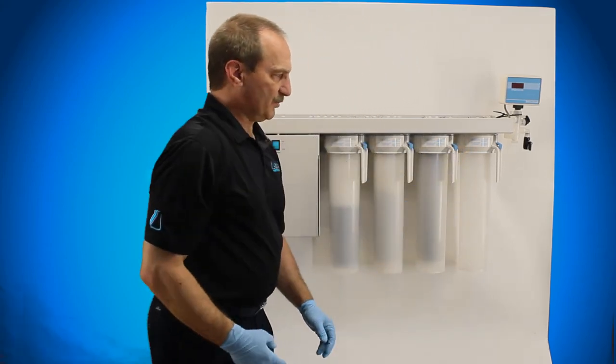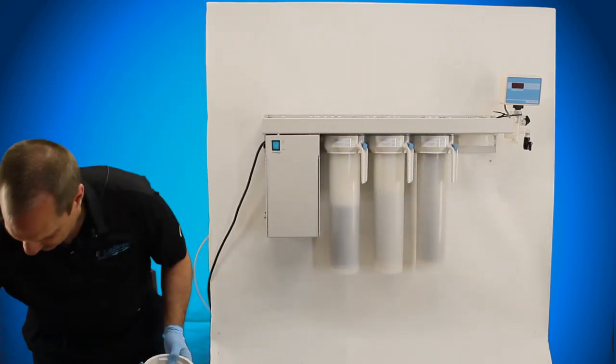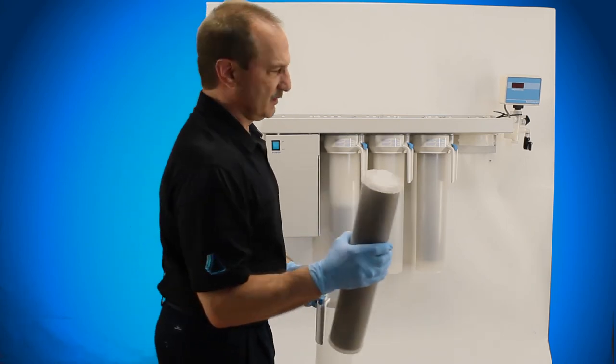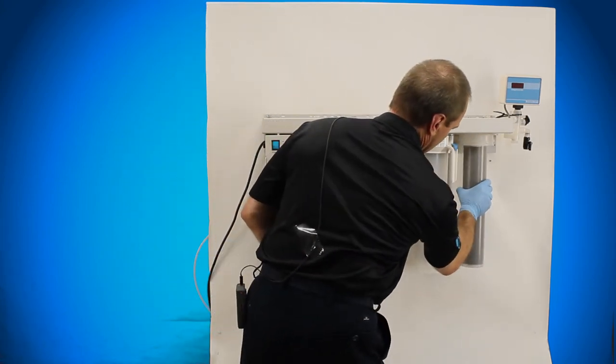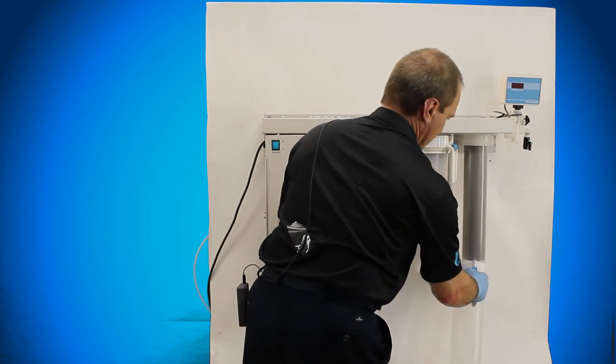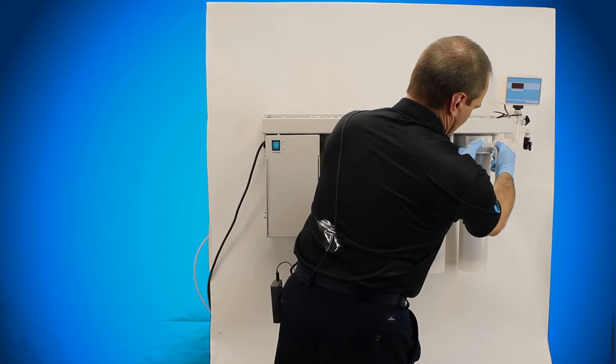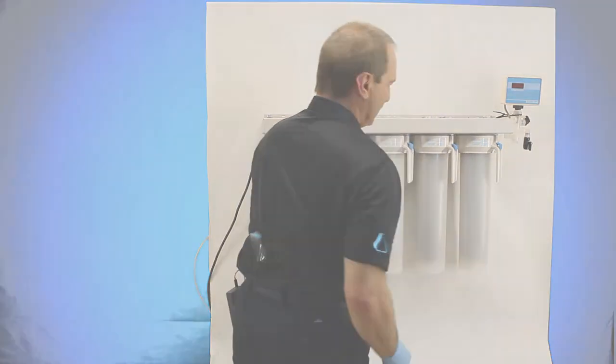Now you've got your last one, your last cartridge. Begin checking your number, push that up into the o-ring, make sure it seats, give it a little twist as you're pushing it up in there, lock it in place.